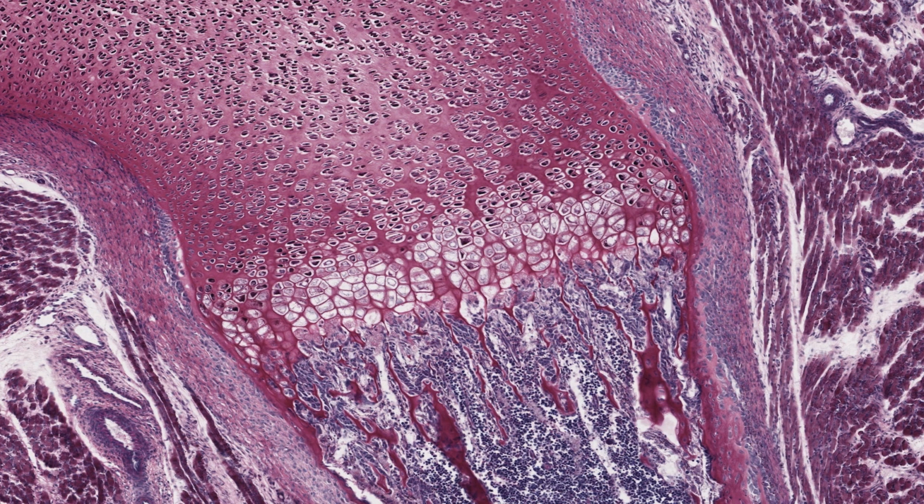To understand what is going on in the bone spicules, it's important to realize that the cartilage matrix is polarized and that cells can distinguish the longitudinal direction from lateral directions in it. This polarity is obvious up in the zone of proliferation, where the cells divide only longitudinally to form stacks of disc-shaped cells. It persists in the spicules of the zone of ossification.